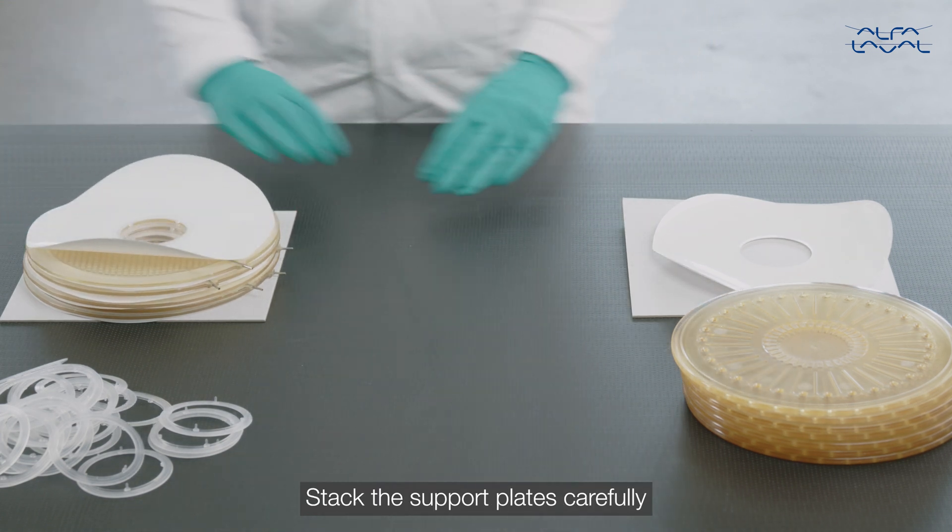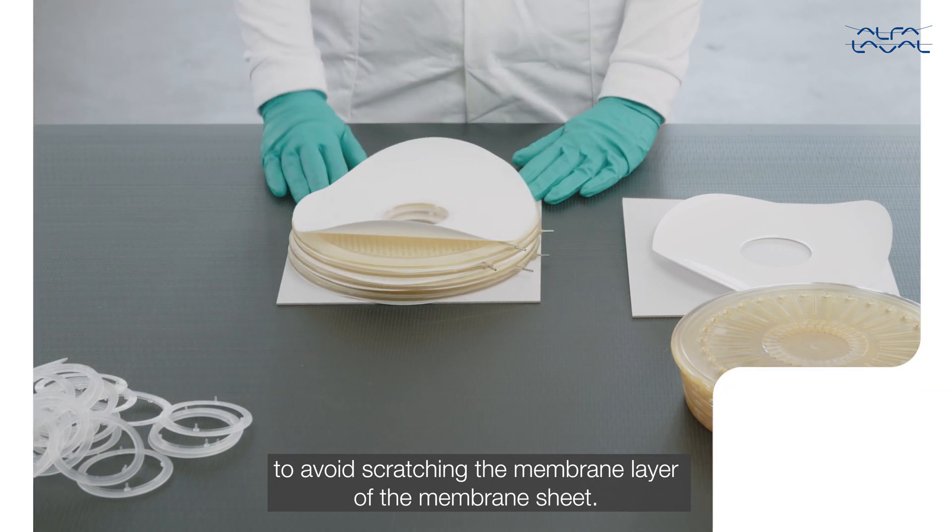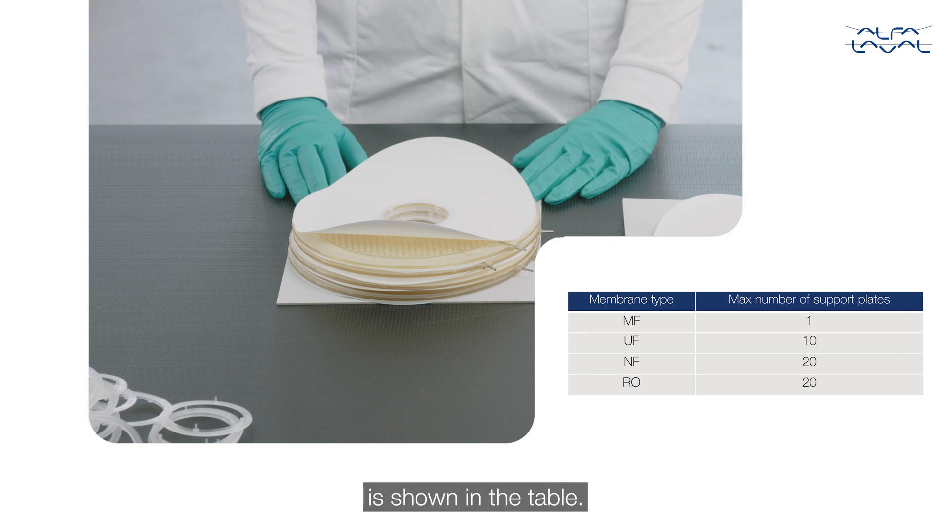Stack the support plates carefully to avoid scratching the membrane layer of the membrane sheet. The maximum number of support plates of certain membrane types is shown in the table.